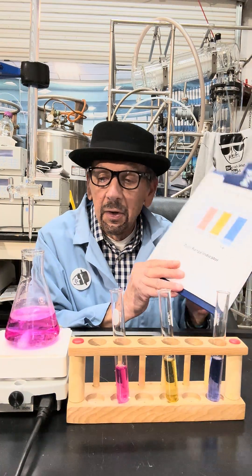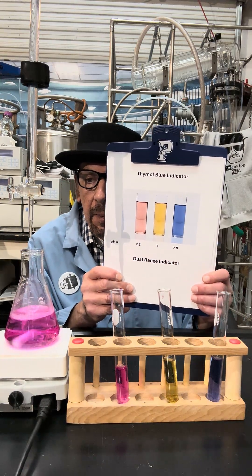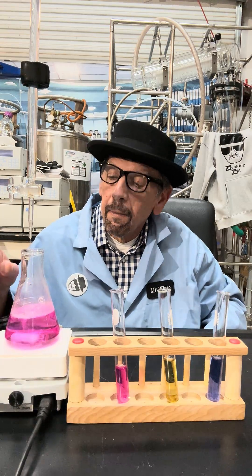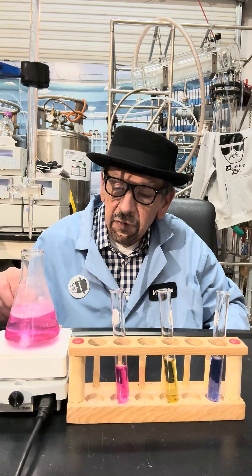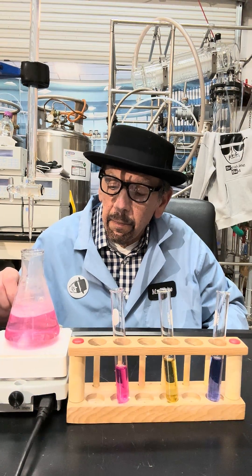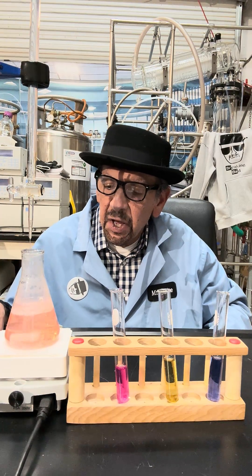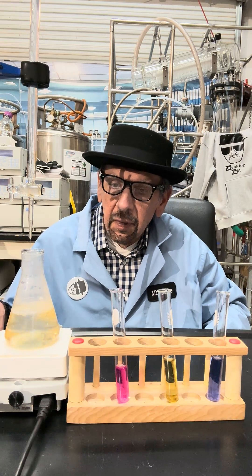This is the indicator chart based on the pH. It's still pinkish red. The next phase should be yellow when it gets closer to neutral. Almost there now — it means the pH is about 7. And eventually it'll change to blue as it gets near 8.